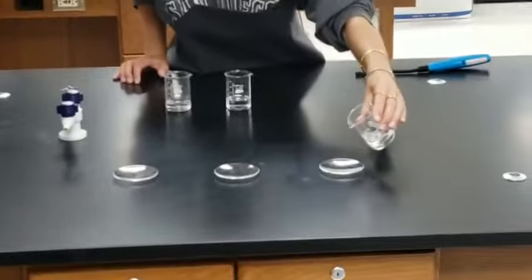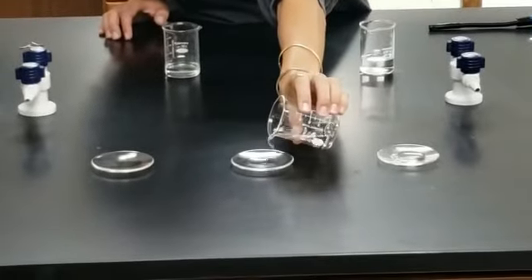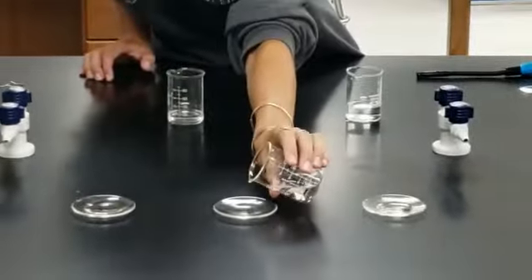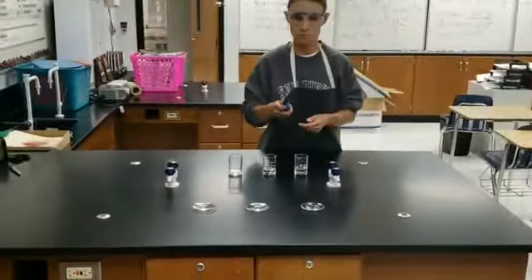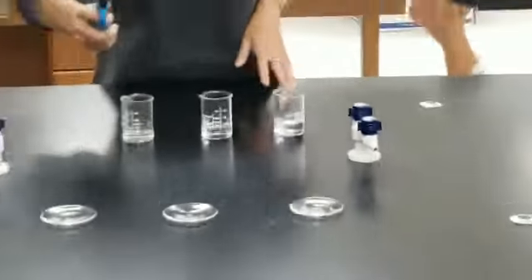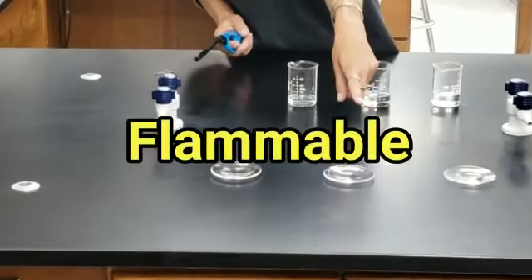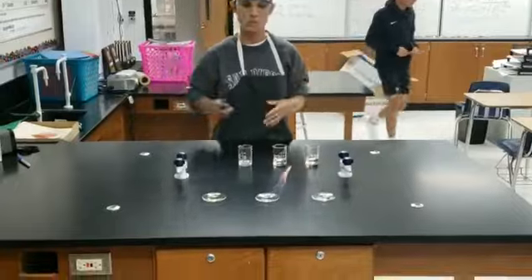I'm going to put each liquid on a watch glass. Let's see what happens — I'm going to try to light them on fire. This liquid doesn't do anything. This one caught on fire easily. So what you need to know: this liquid is highly flammable and it catches fire. Let me try the third one. This one didn't do much either.